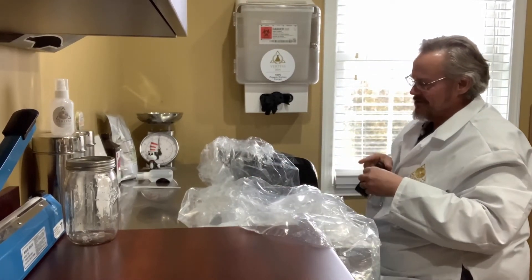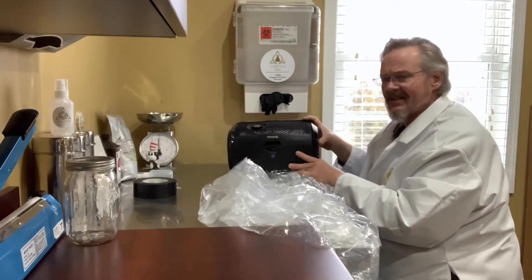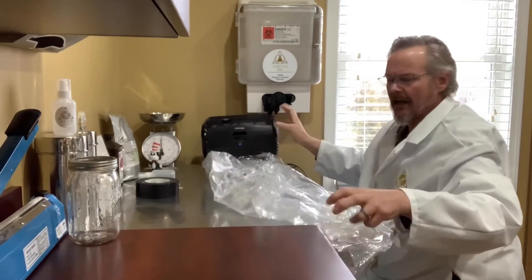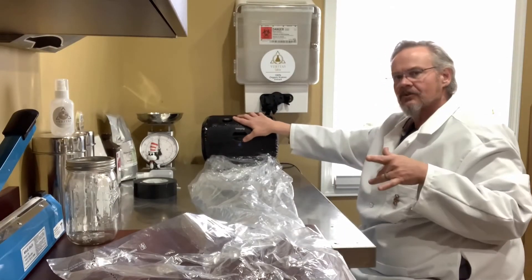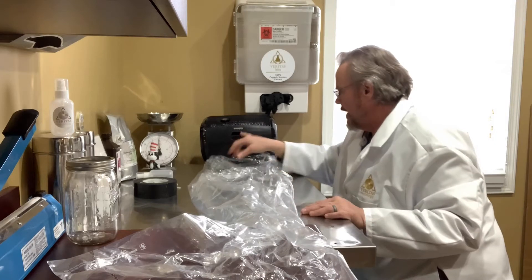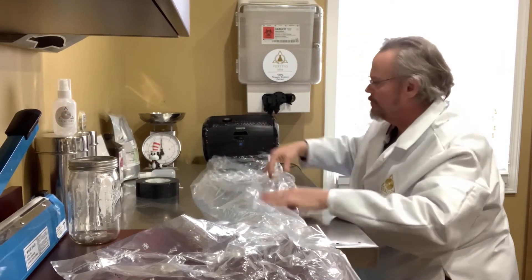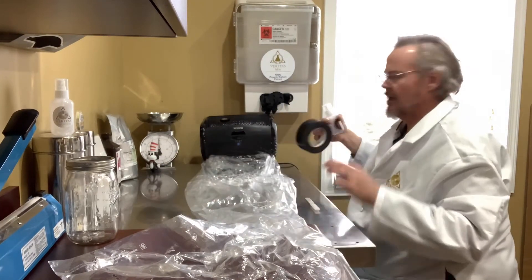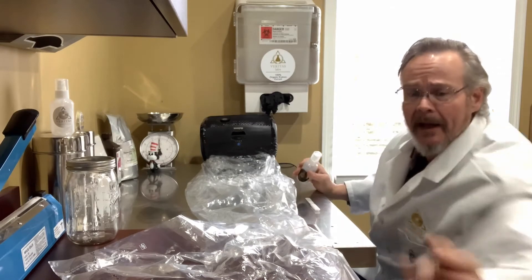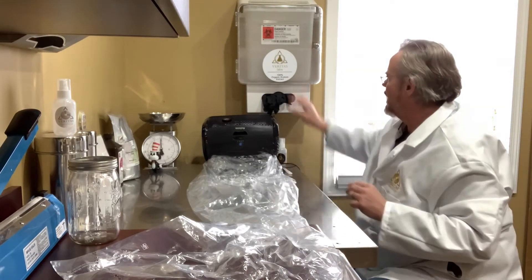So anyway, this is your tape job. I'm going to turn this up on its side so that the exhaust is forcing out and just play the bag out a little bit. This has variable speed control with three different speeds. You'll want to have your scalpel ready, your ISO ready, and you can put your tape out of the way. Your ISO sits over here and you'll want to go ahead and glove up now.